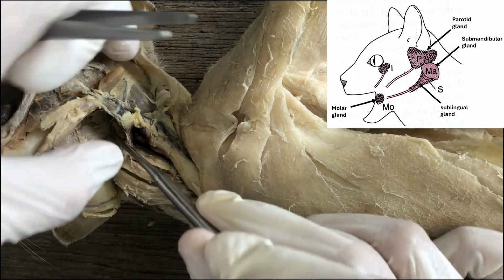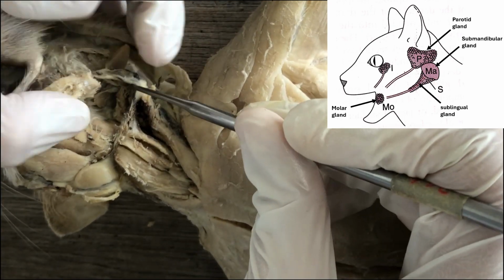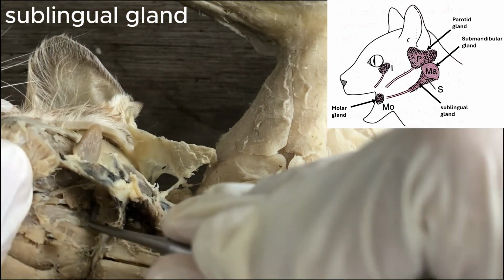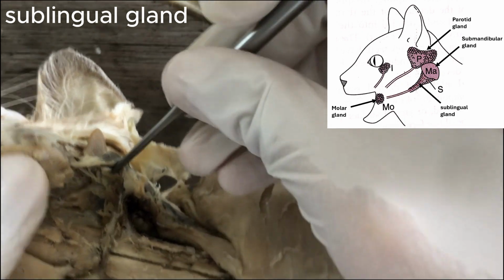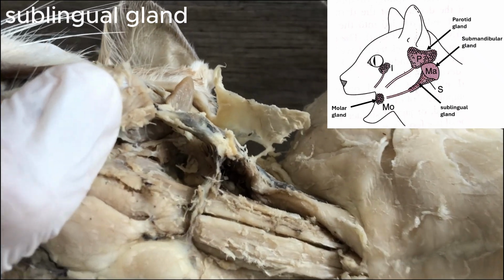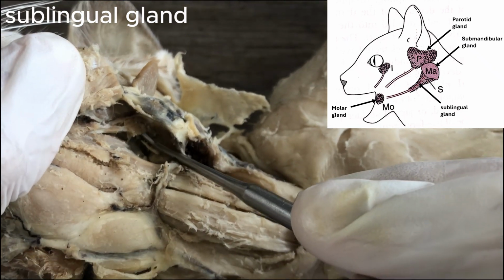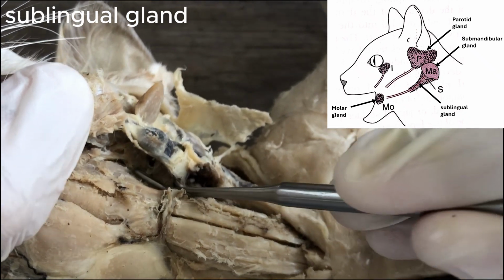And so once you've done that, the sublingual gland is here. Let me see if I can focus. So this one, the one beneath the probe, is the sublingual gland.